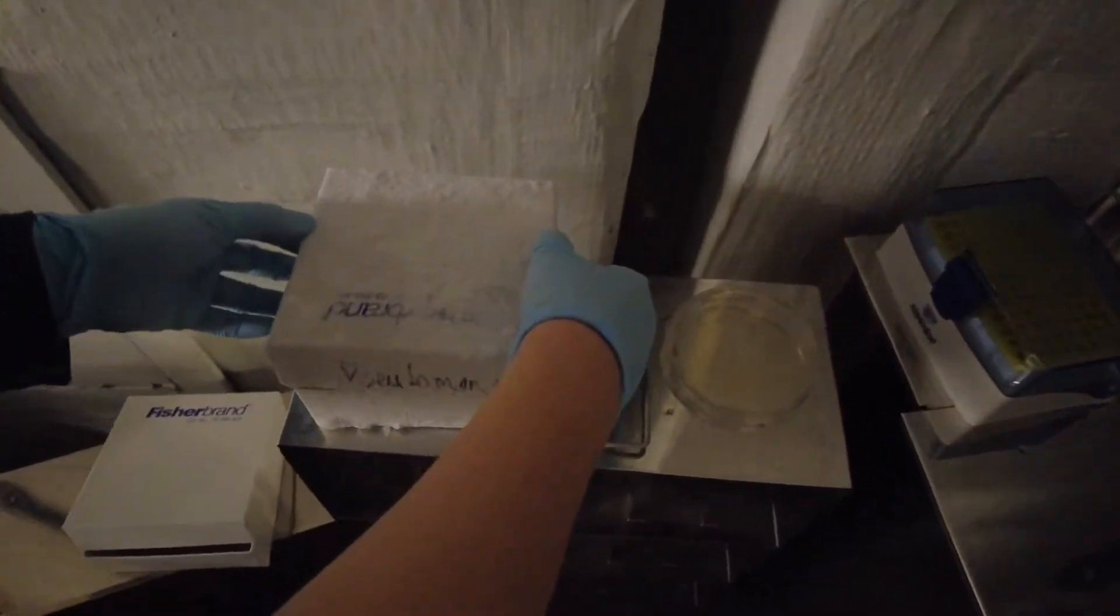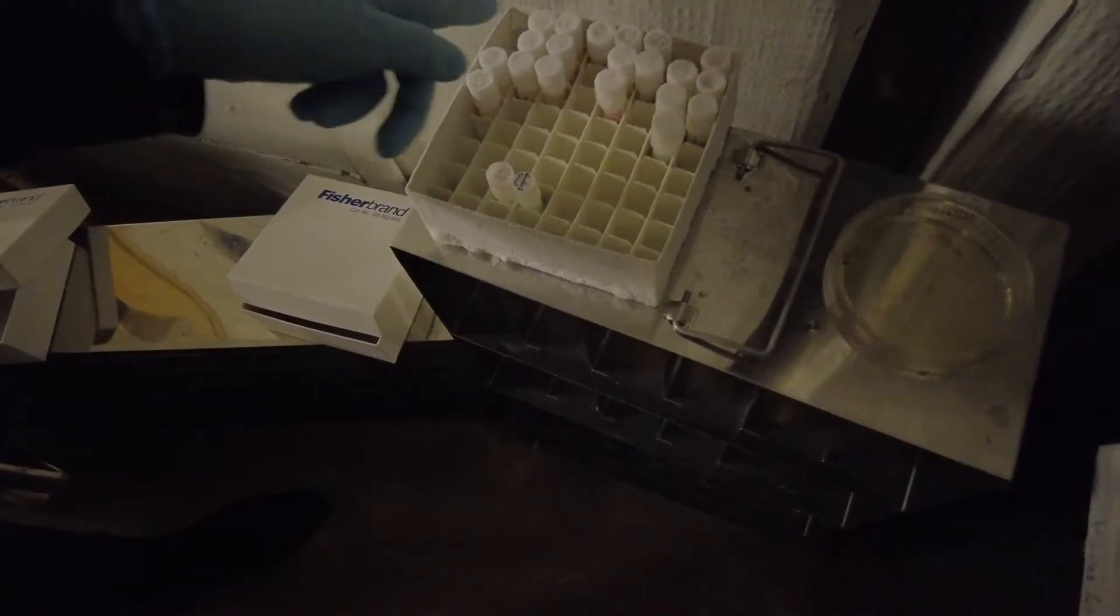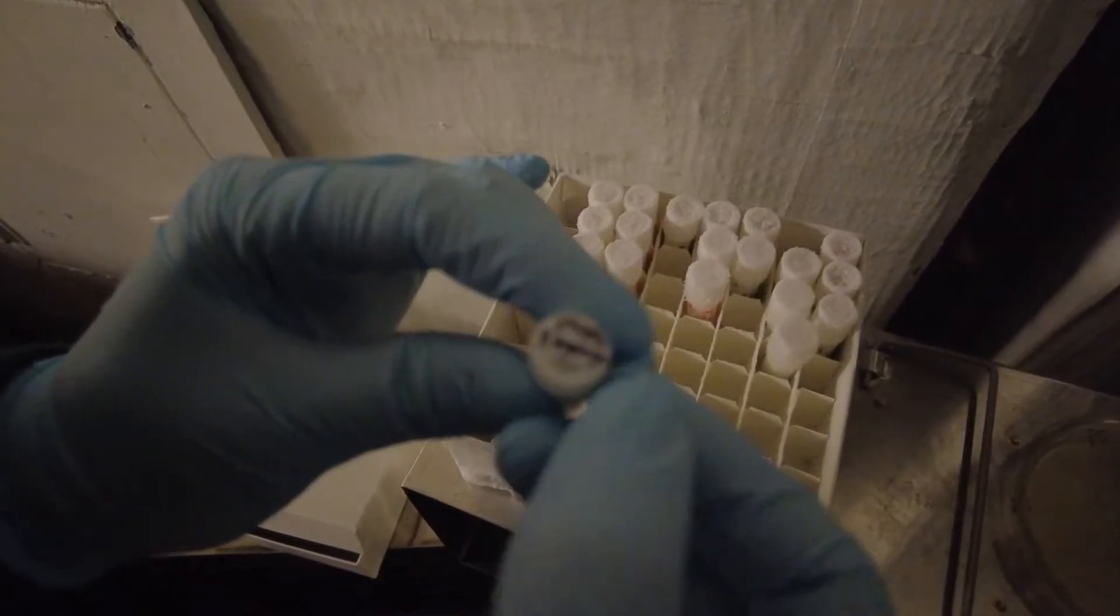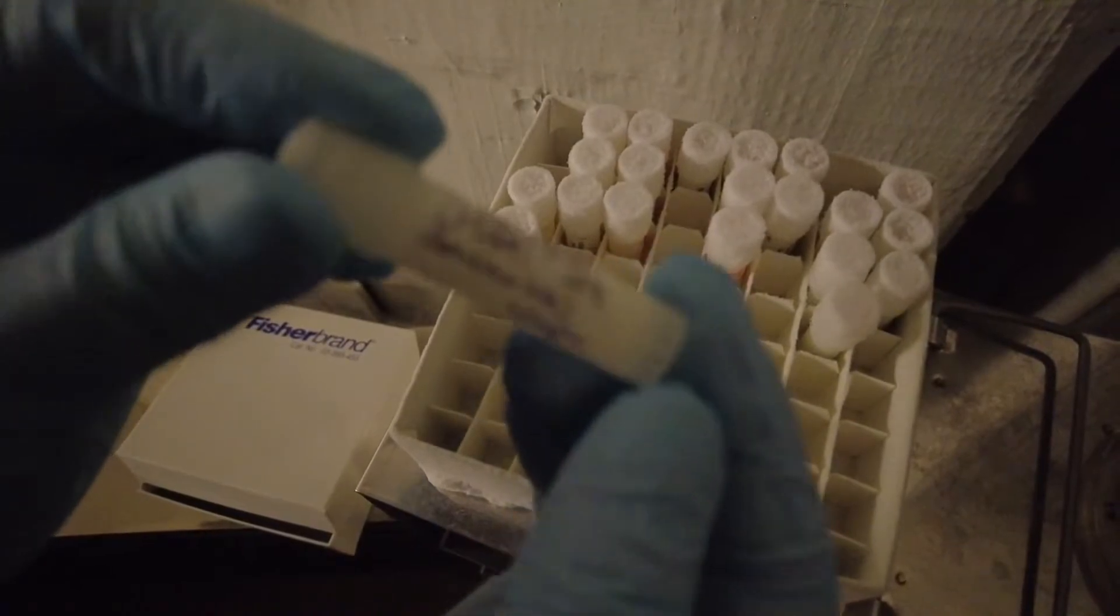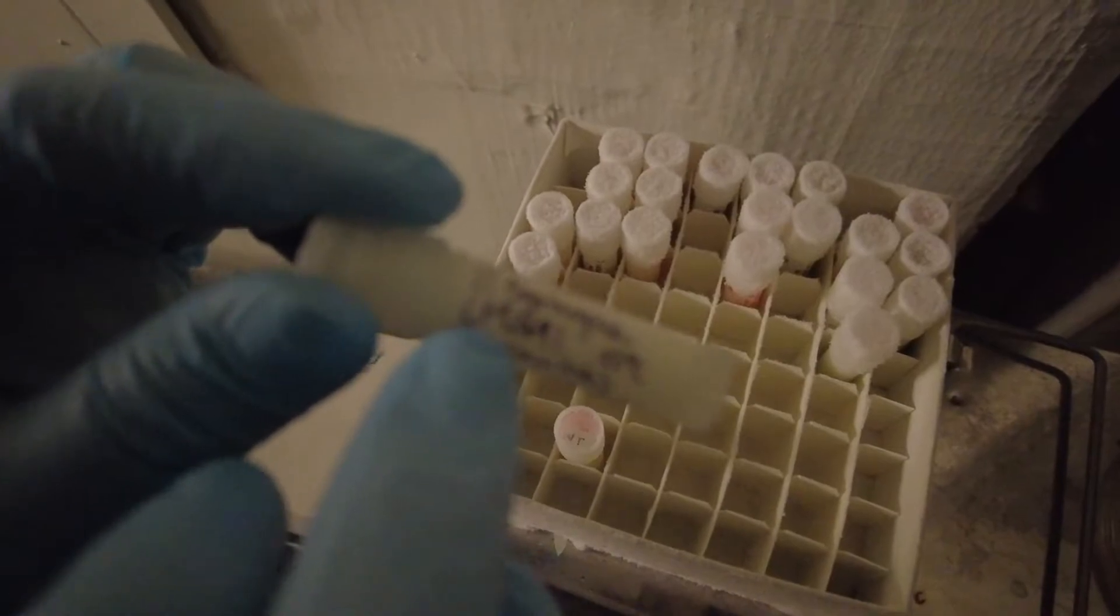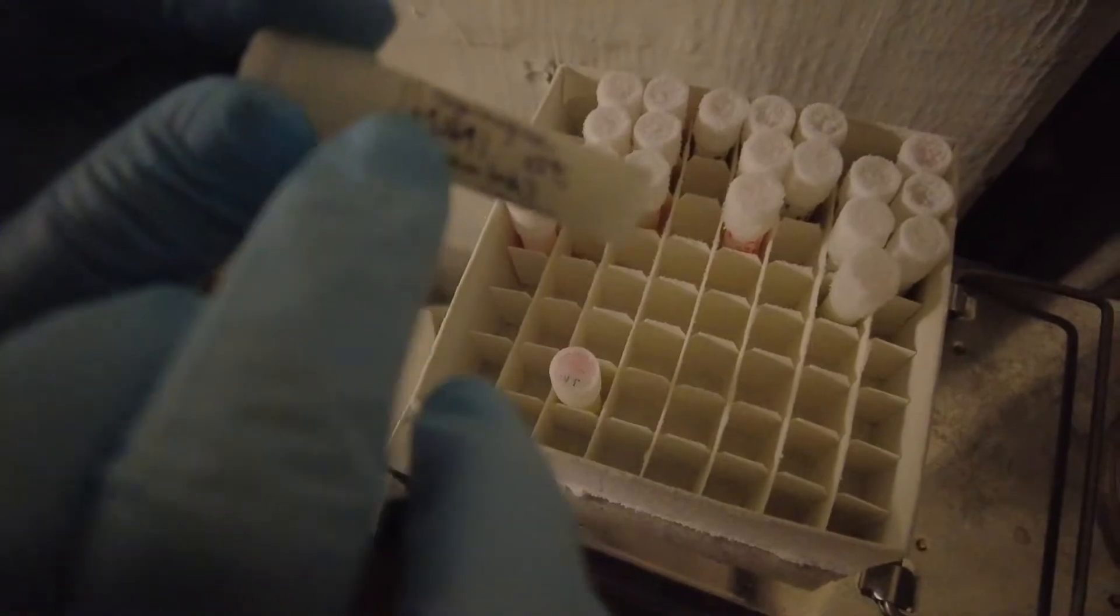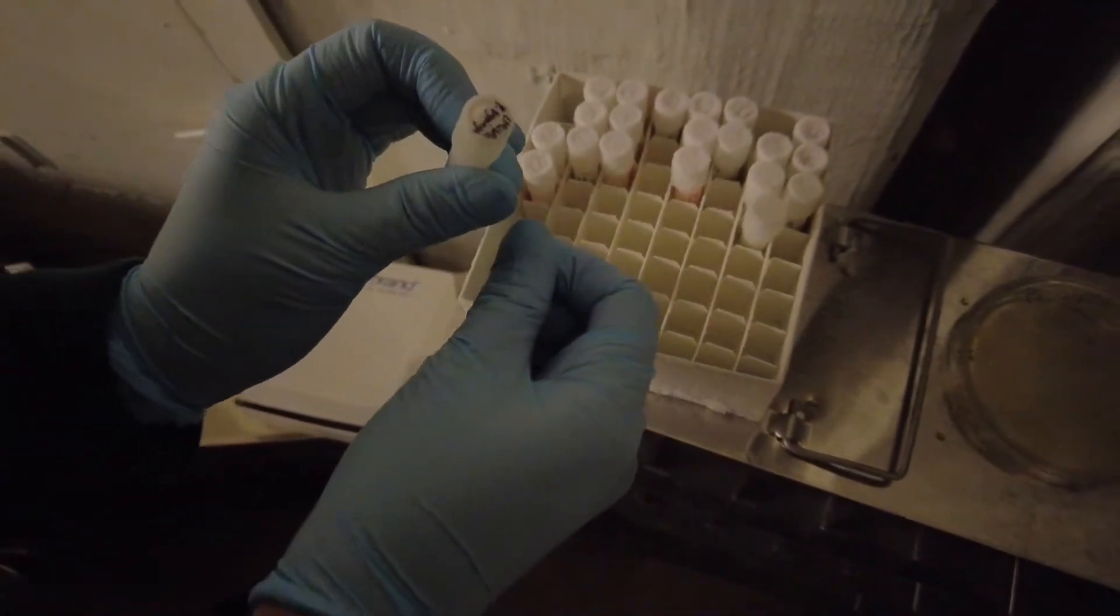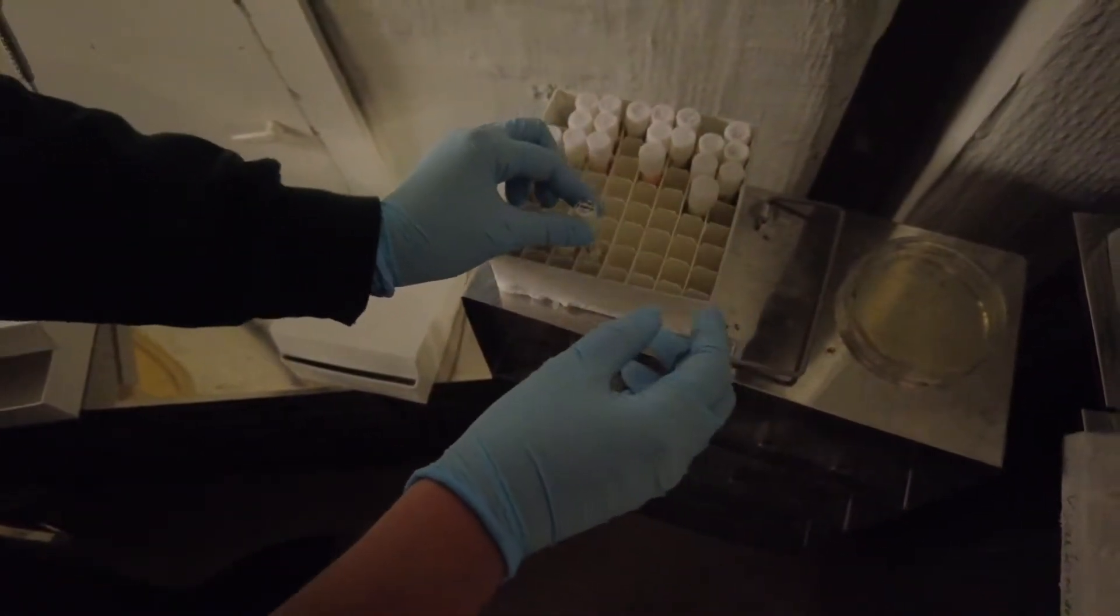Now you open this box and you open this box. I made a strain list for these vials, but the ones that you use—Pseudomonas syringae is here. On the side it has the date that I saved it, where I got it from, and the growth condition, room temperature. I think this is the name of the strain. I'm not sure if this is focused. It's okay. She'll see. It's pretty obvious.